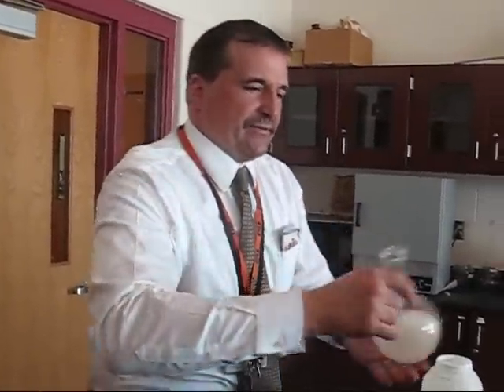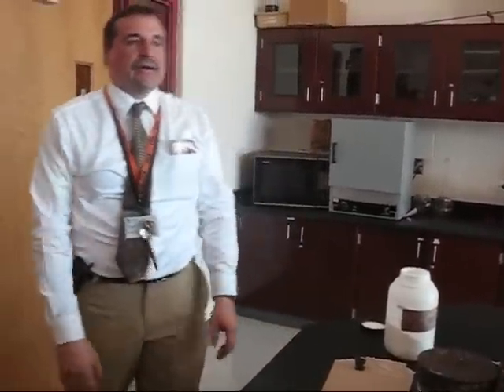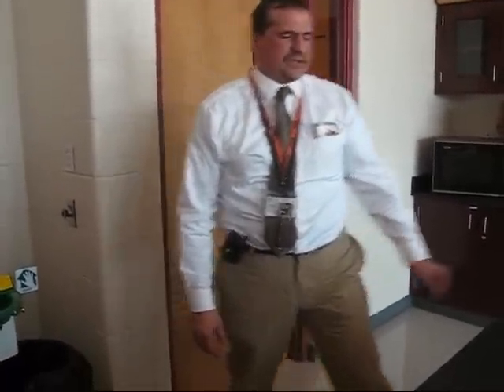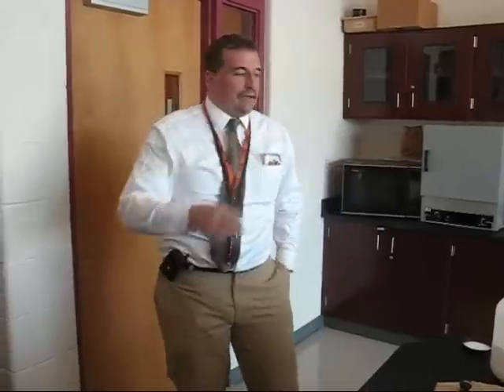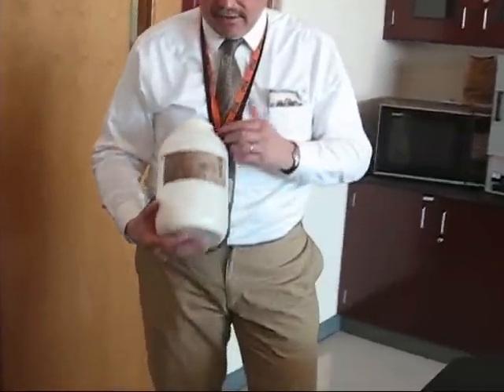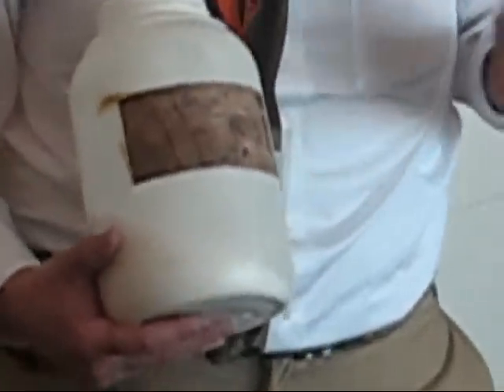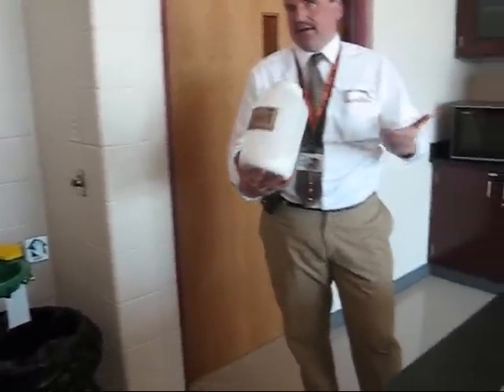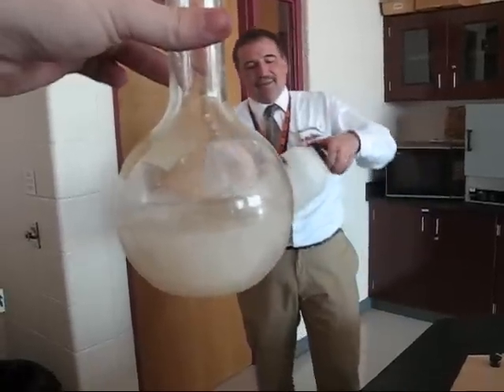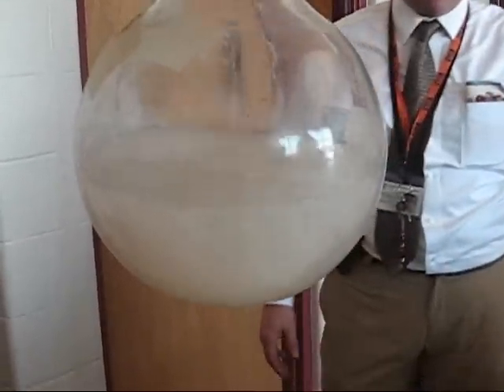I feel some heat — you can pass it around. This one's still a little warm from its previous crystallization, so you can feel the bottom of it. It's warm. It smells like a lukewarm puppy. What does it smell like to you? Go ahead, it won't hurt you — it's actually food. Vinegar? Correct. It's not actually vinegar, but it's got one of the same ions as vinegar — an acetate ion. So it will give you a little bit of a vinegar smell. It's often added to food, though you wouldn't want to eat it directly. It does give a little bit of a vinegary flavor.